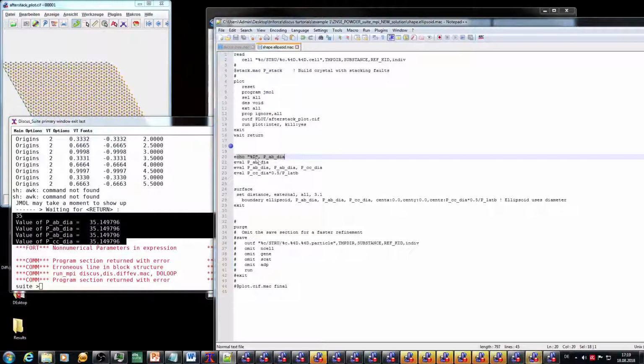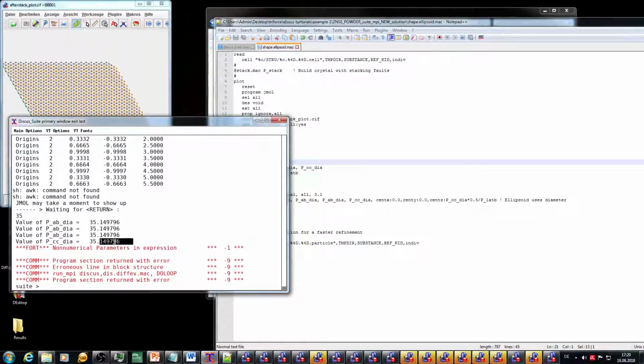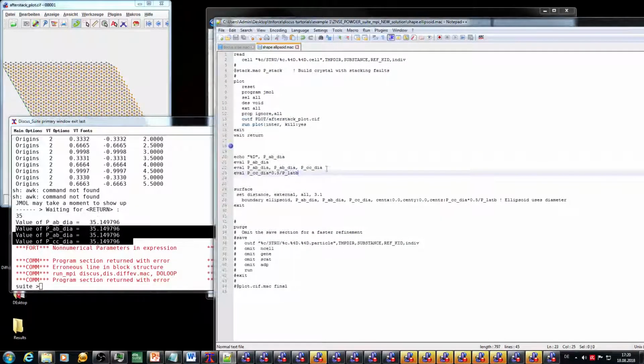It's rounding, because I didn't specify the %d, the value of the diameter. So the diameter is officially at the moment 35.15. And yeah, so this is the exact value. With the evaluate, you'll get an exact value with 8 digits. And then the next 3 lines here are this evaluate, showing you the 3 parameters here. And again, the CC diameter is equal to the AB diameter.